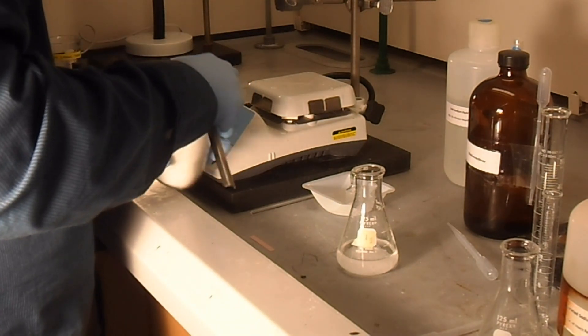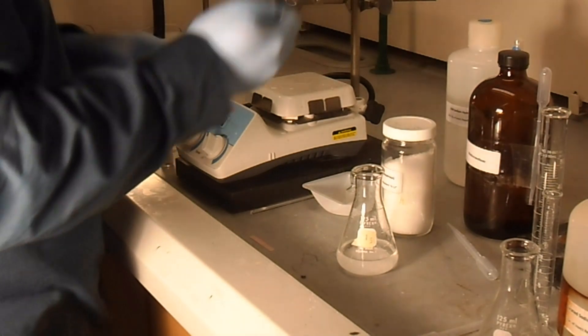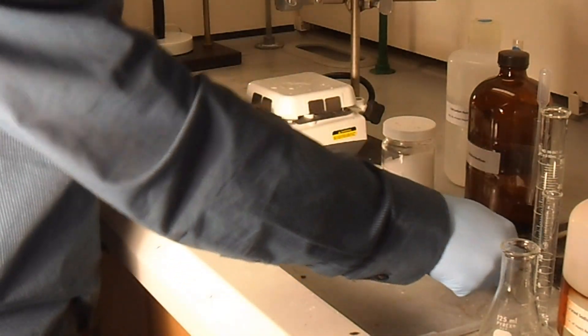And remember, we do not want our drying agent to clump. So, as soon as it does not clump, you're good to go.